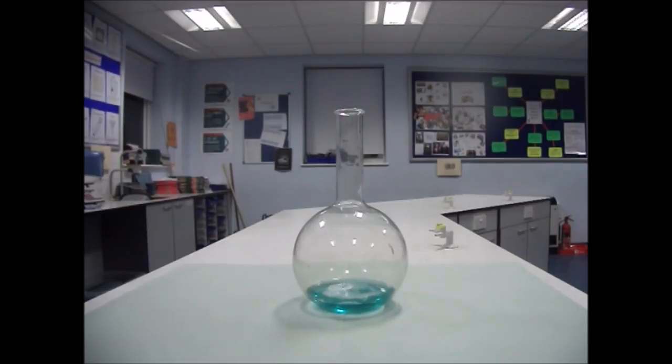To catalyze the reaction, I'm going to add a small amount of saturated potassium iodide solution. Watch what happens to the vessel when I add the potassium iodide solution to the flask.